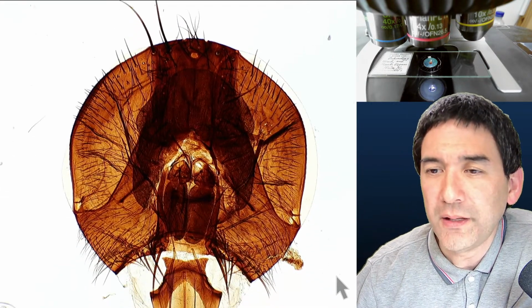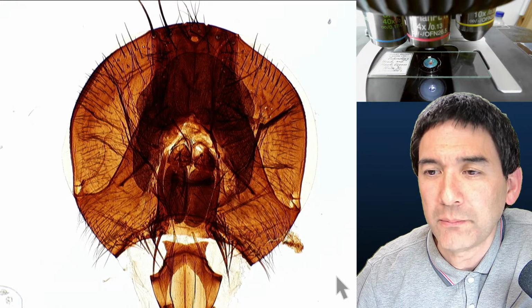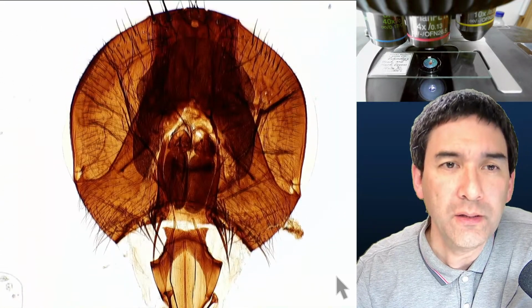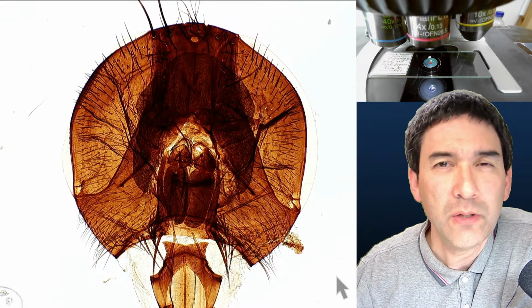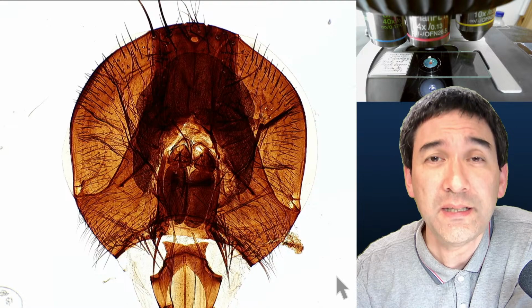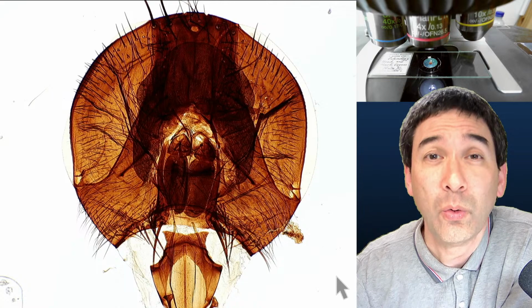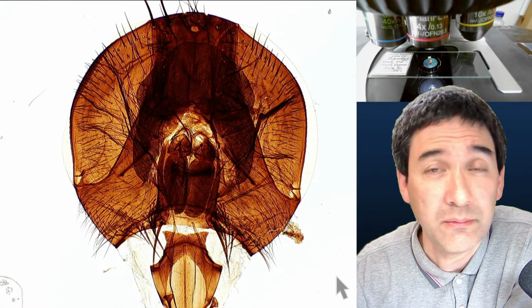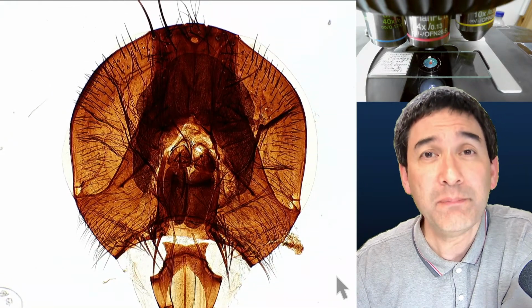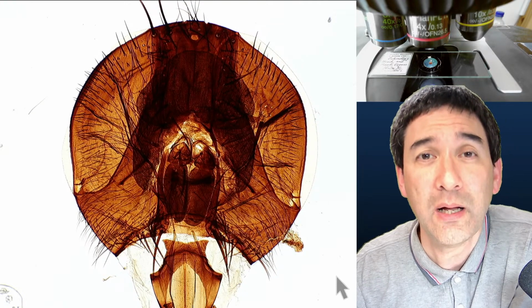Another question: is there something more or less easily accessible that I can use for making insects transparent? I looked at them with the top light, but they are black. Yes, as a matter of fact, for bleaching, you have to do a little bit of research, because I did not try this myself yet. Bleaching is possible by placing the insect for some days into KOH solution, potassium hydroxide, or some other alkaline solution like NaOH, sodium hydroxide. Some alkaline basic solution will actually bleach the insects, and then you have to dehydrate them.